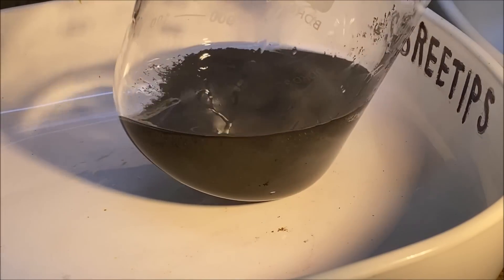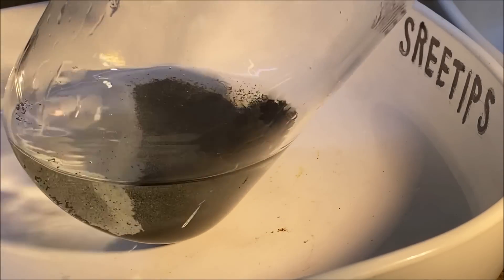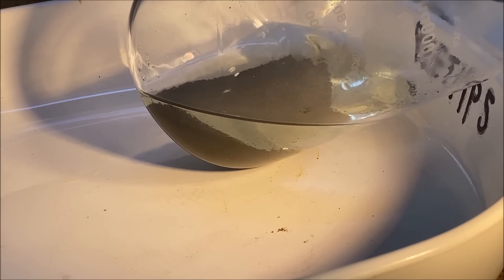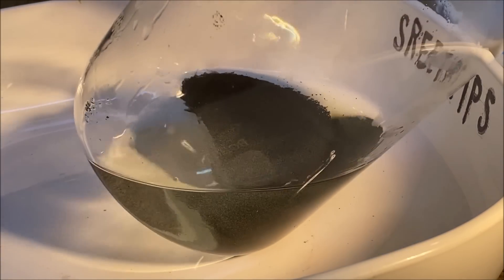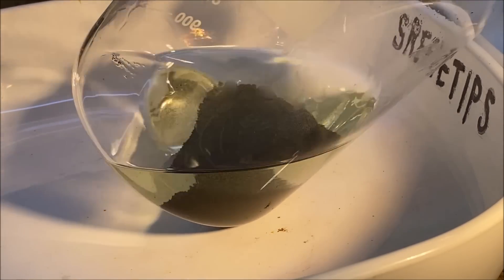As you can see here, I don't see a whole bunch of... That's kind of hard to tell.